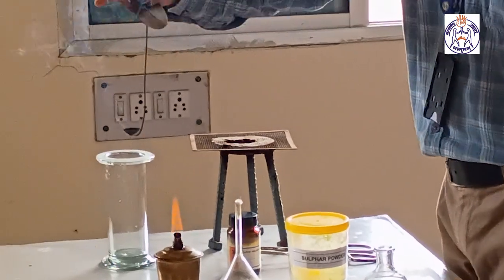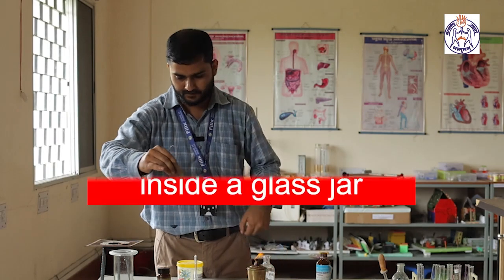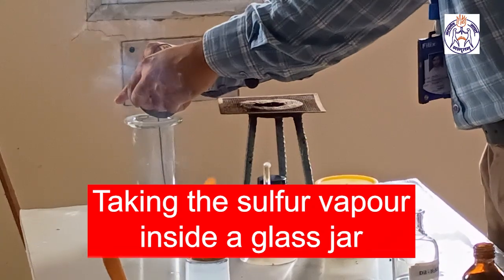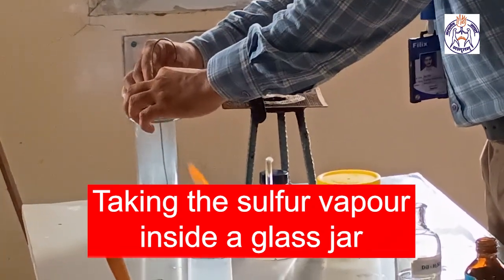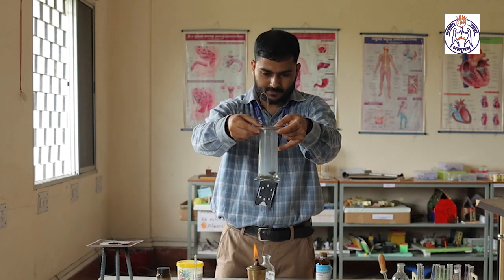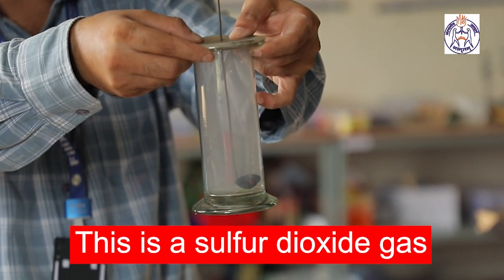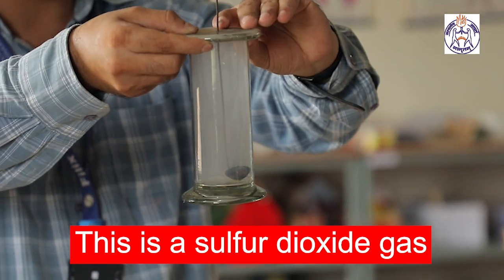Now the sulfur burns. I am taking that sulfur inside a glass jar, keeping that vapor inside the glass jar, and the gas is nothing but sulfur dioxide gas.